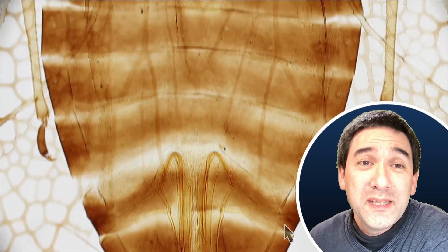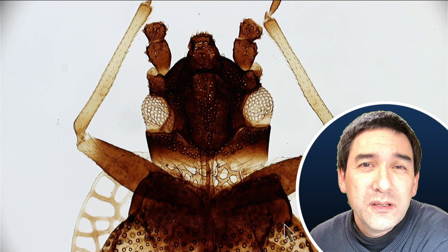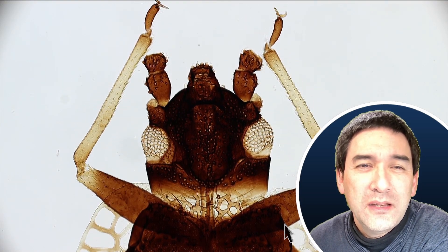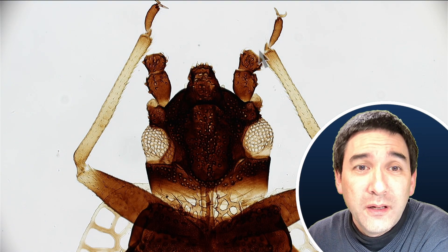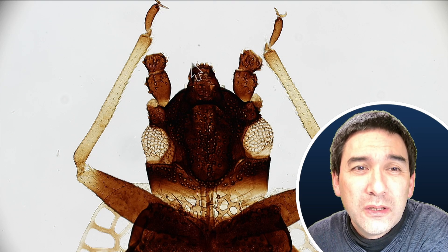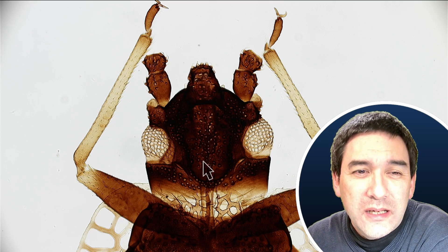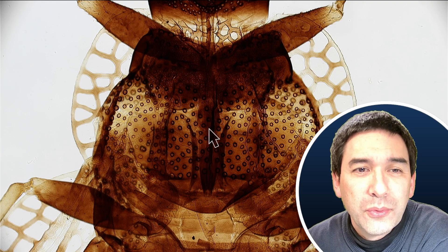In any case, the specimen — if you look here — I'm on the front as well. This interesting specimen also does not have very long antennae. I do suppose, or at least hope, that the antennae have not broken off here. I'm not able to actually see this properly. And look at the mouth parts over here — I think this almost looks like it has a very long proboscis, like a tongue. You're able to see it shine through here, because otherwise I'm not able to see any mandibles or any other mouth parts. So I do not really know what insect this is.